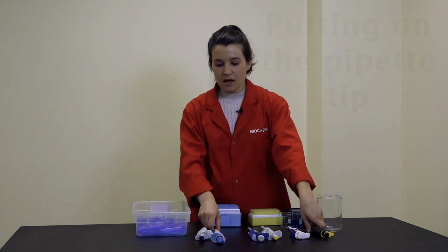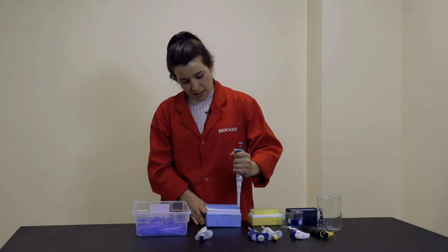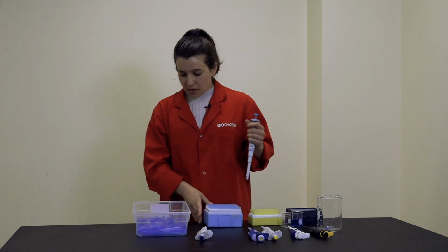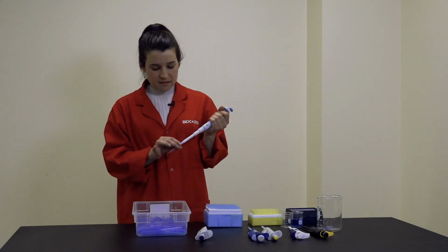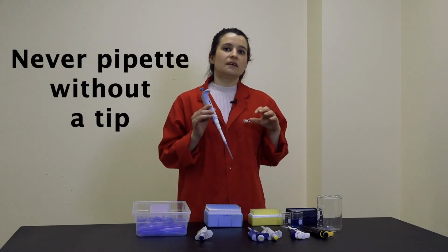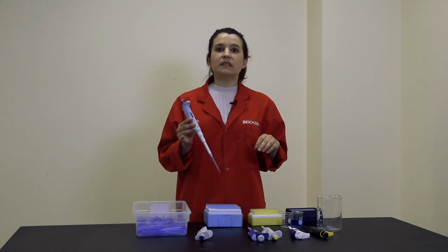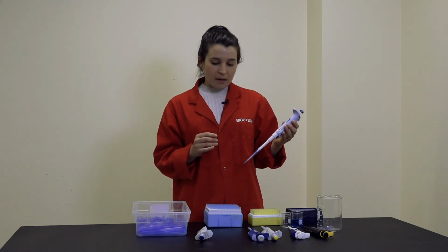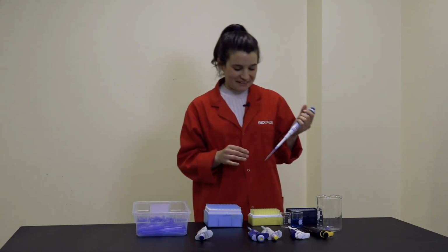In order to put the pipette tip on, you simply pick up your pipette and firmly place it in the tip and bring it out. Now, in some cases, your lab may use bulk tips. In that case, you just simply pick up the tip like this and put it firmly on like that. So again, you can never, ever pipette without a pipette tip on. This will most certainly damage the pipette. It wouldn't work very well, and you would also contaminate the solution that you're pipetting.